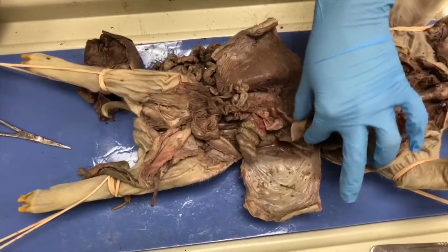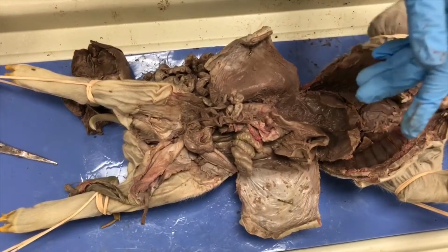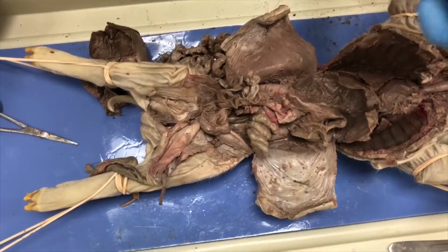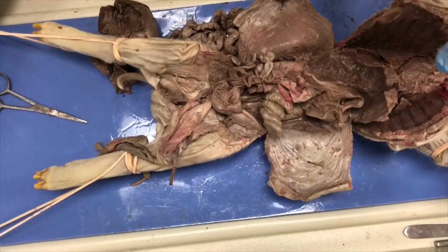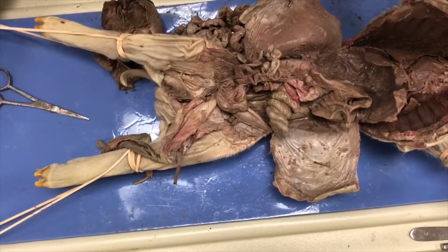We're now doing the endocrine system. It coordinates activities of its many organs and organ systems, but the endocrine system is ductless, meaning it relies on another neighboring system to send its messages throughout the body.